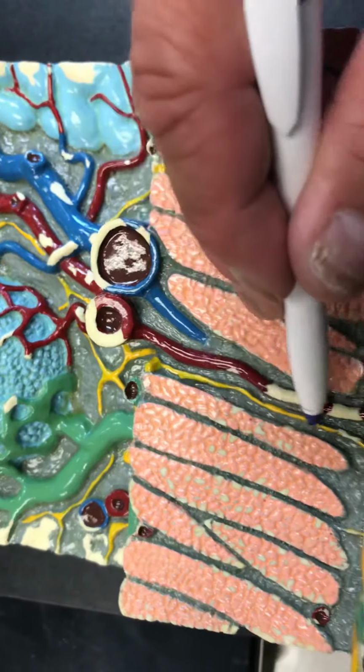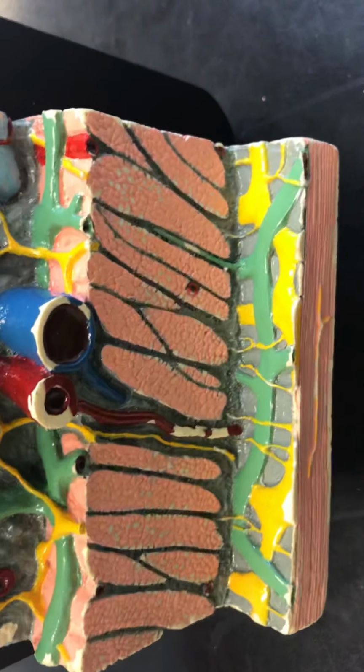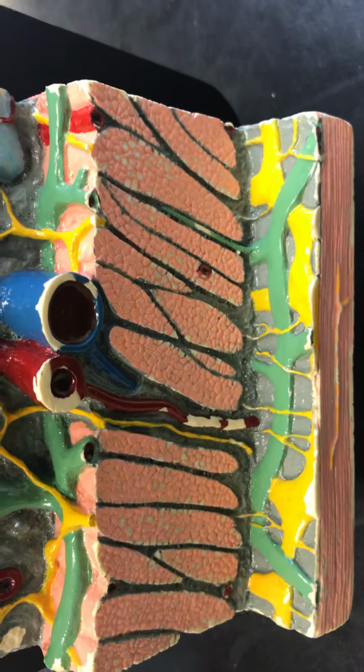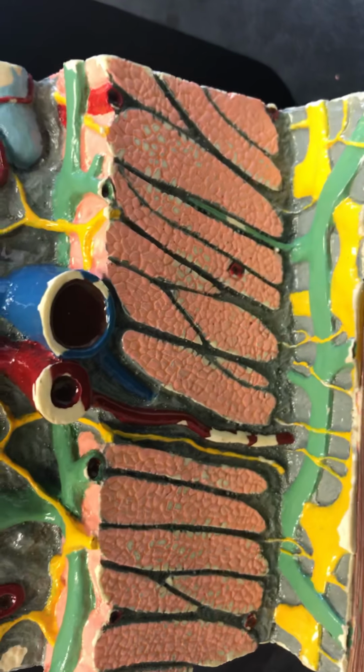Now, deep inside, between these two, you also see the yellow neurons as well. The yellowish neurons that we see here are called the myenteric plexus, and they allow for the reflex behavior that we see when we introduce food into the GI tract. So with the introduction of food, we're able to stimulate peristalsis and mixing. Again, this doesn't require a functional vagus nerve.